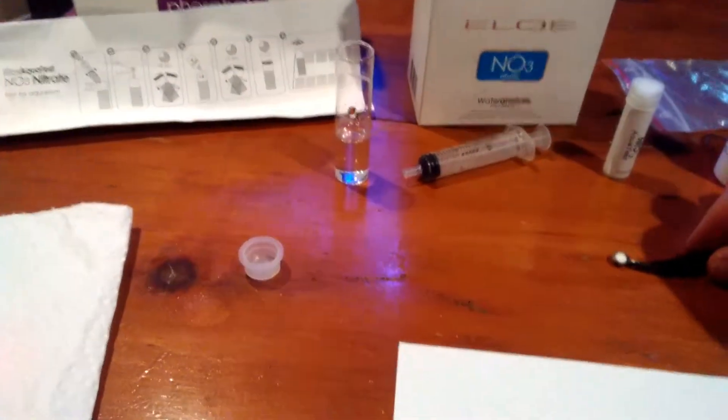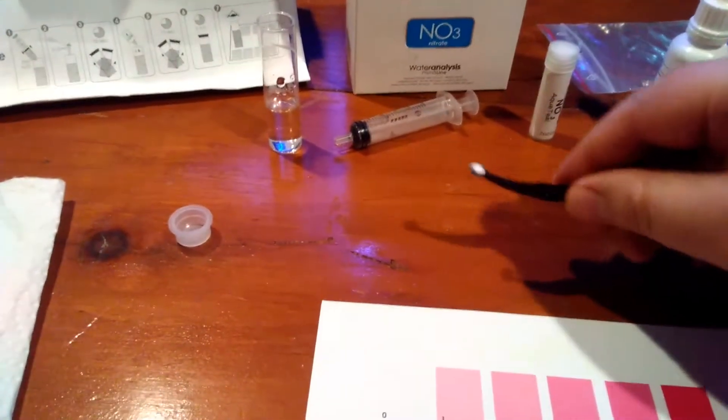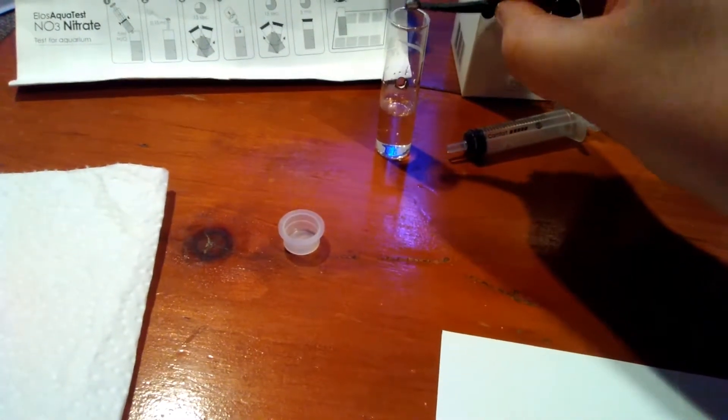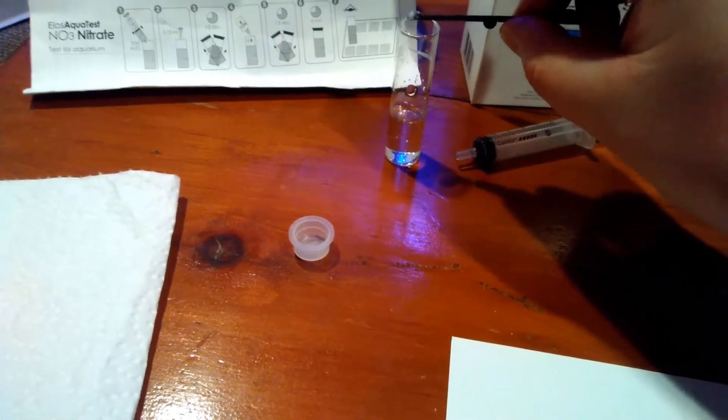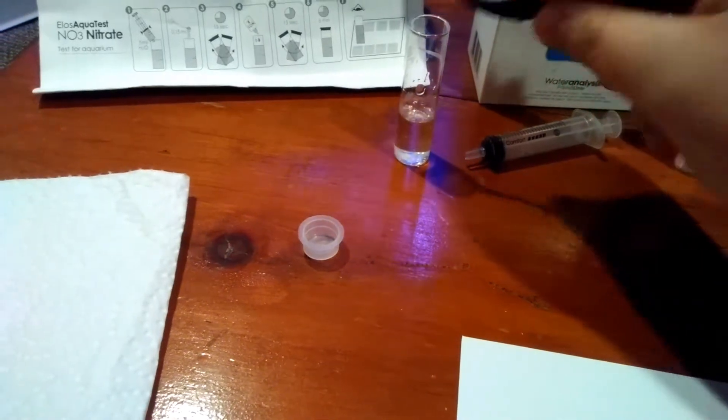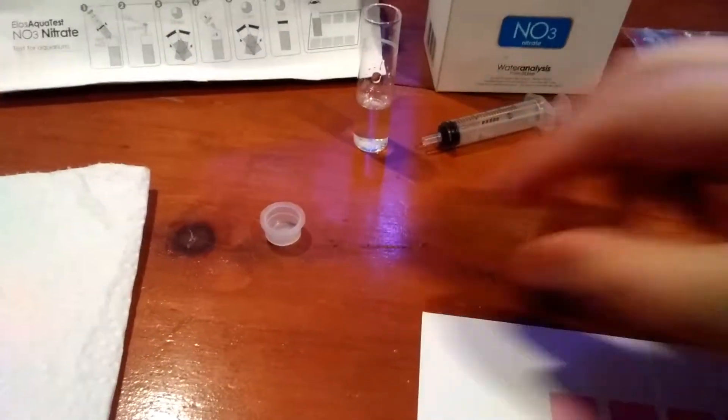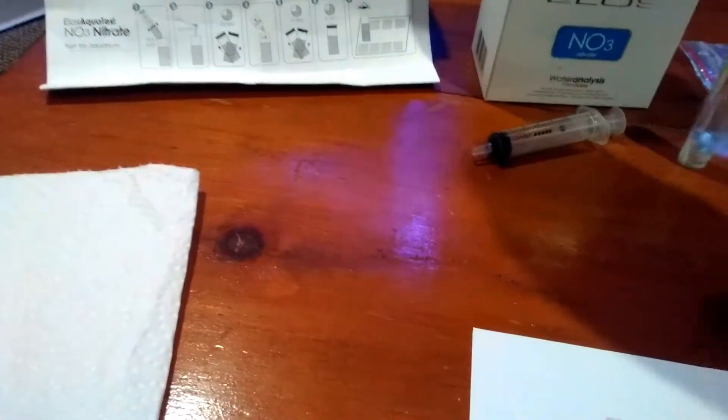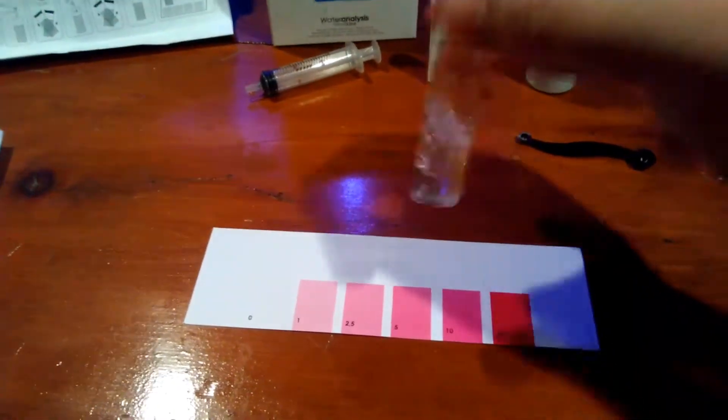Alright, so I'm going to do this. Here's the powder. Now they say it's not a big deal if all the powder doesn't dissolve inside the liquid, which is your tank water. Just shake it up for 15 seconds.